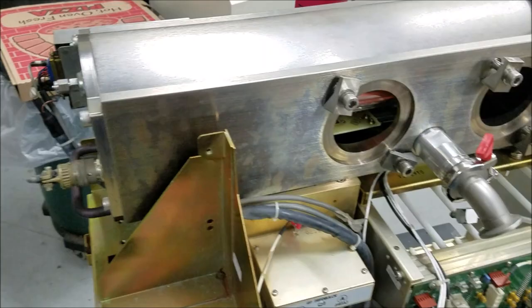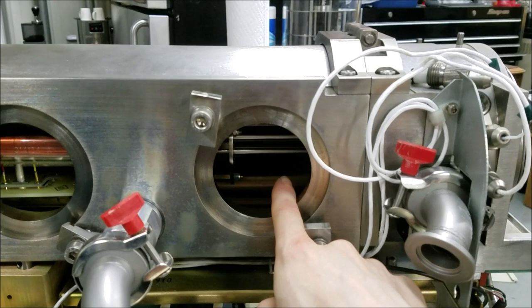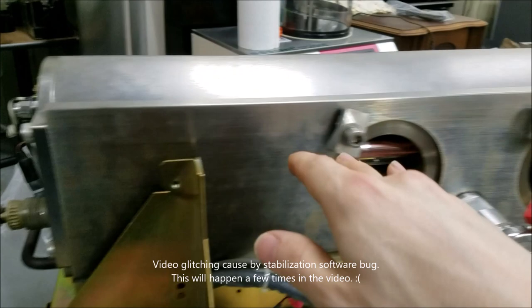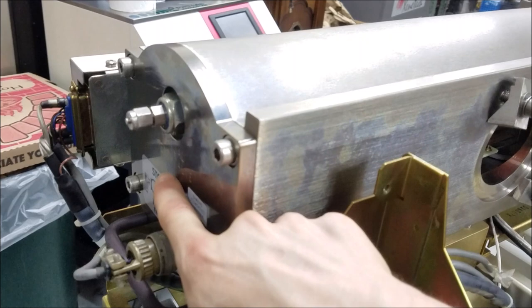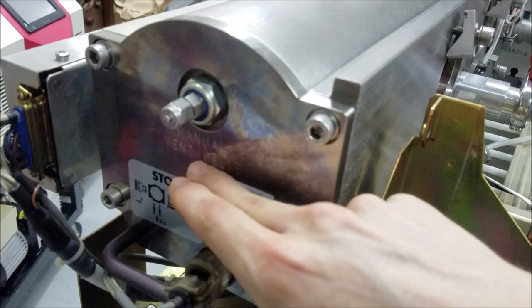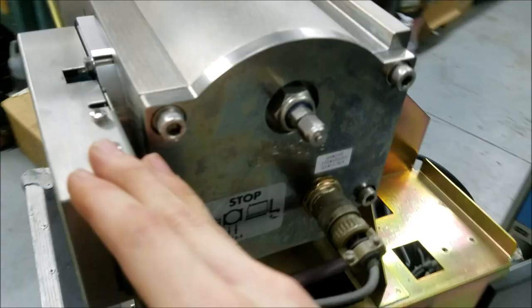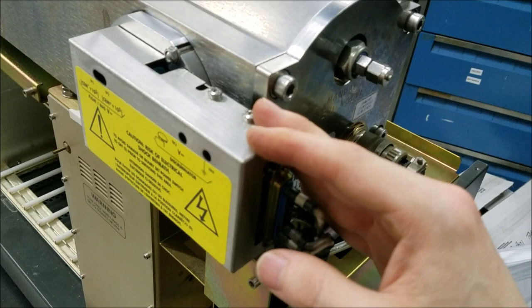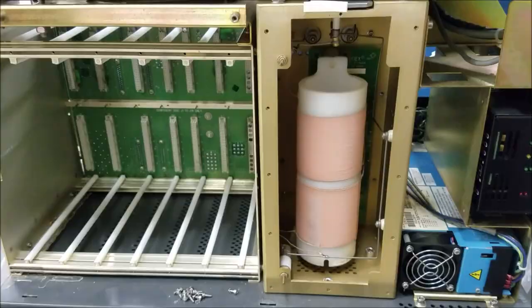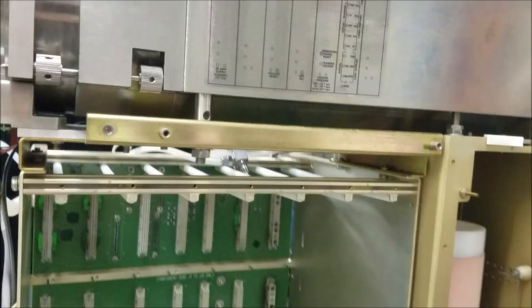The sensor head — if you think about it, the spray goes in this way, gets ionized and charged, goes through the quadrupole mass analyzer. It comes this way, and then the ion that makes it through the quadrupole mass analyzer ends up going into the back here, which is the anode, and it collects those negatively charged ions that make it through the mass analyzer. This is probably the preamp that comes off of the sensor head on the inside. Getting that top section separated from the rest of the unit is going to be a little tricky — we have a couple of nuts that need to be undone here.